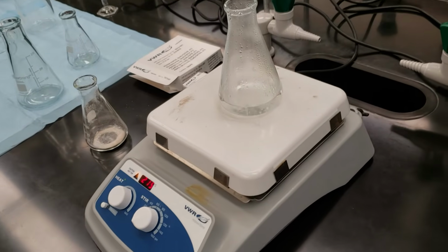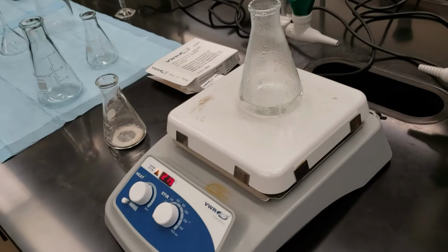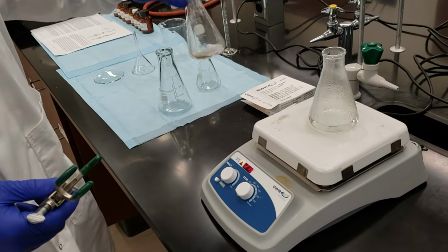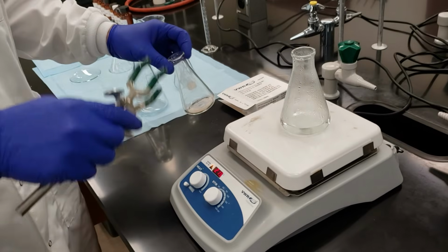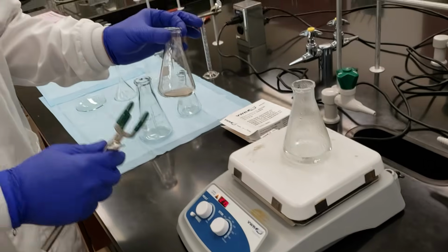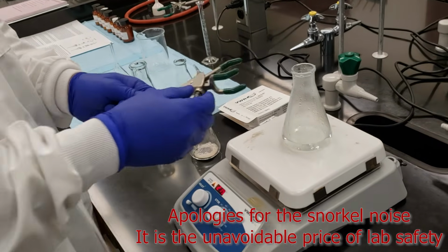All right, so our water has come to a boil. We're going to use small aliquots of our boiling water to dissolve our heterogeneous mixture in this 125 ml Erlenmeyer flask. Once I start adding the water in, I'm going to place it onto the hot plate, but I don't want to do that just yet.